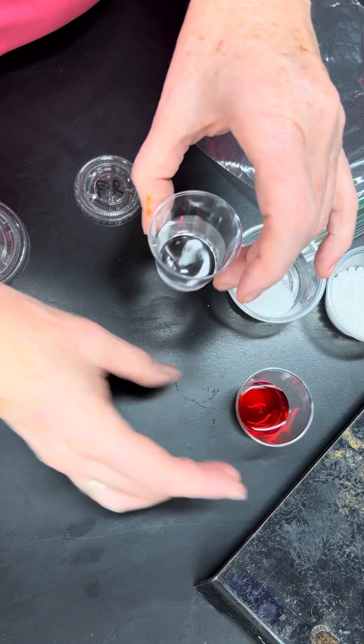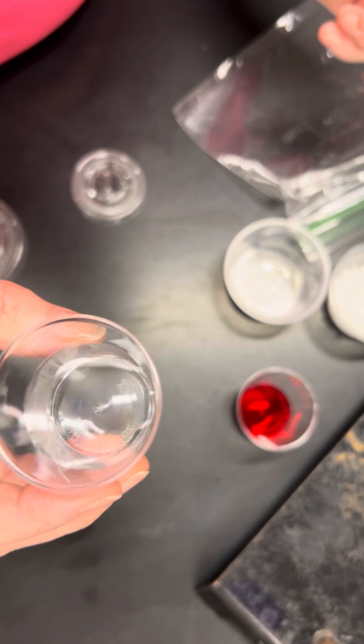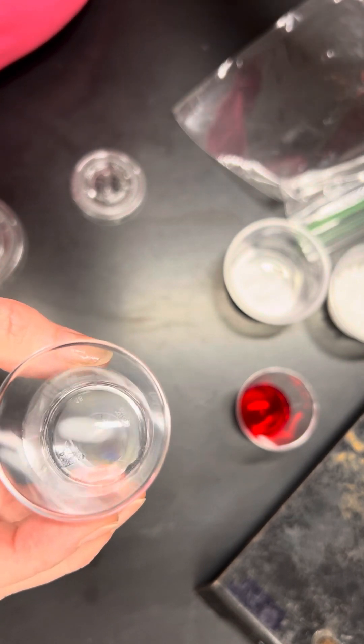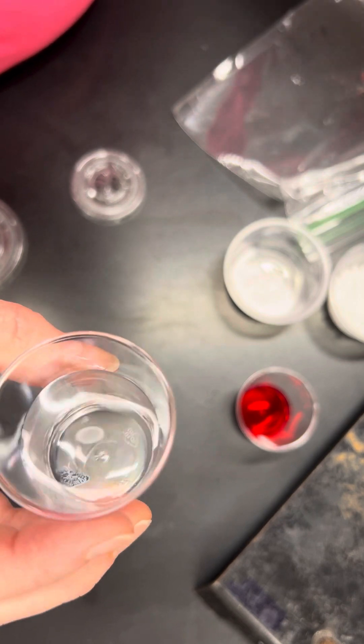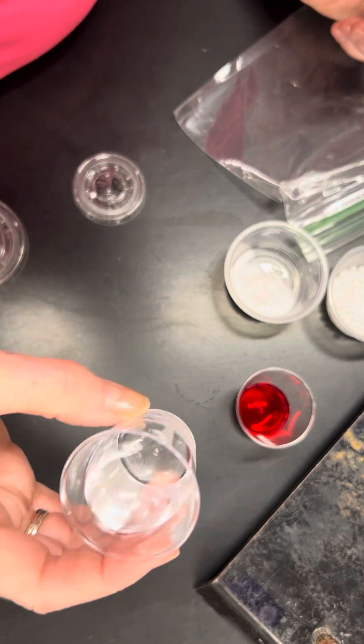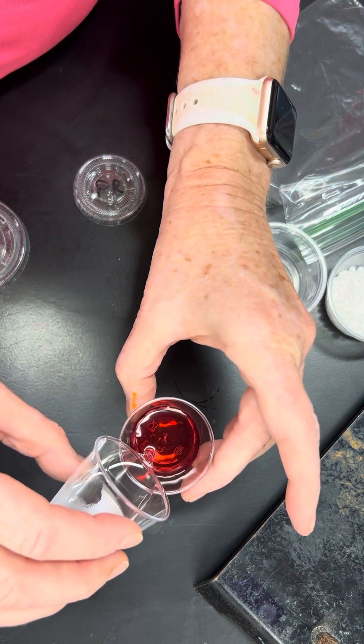And our last substance is water. As you know, water is a clear liquid. It is not toxic to humans. It is odorless, tasteless, and again very thin and easily pours. These 10 milliliters of water are going to be added to our 5 milliliters of phenol red.